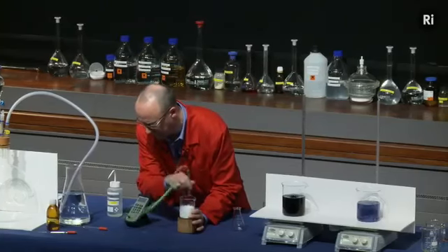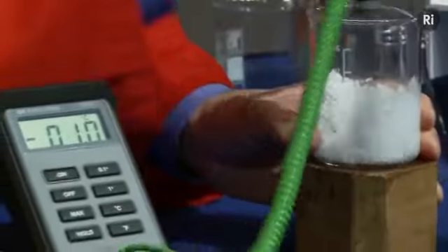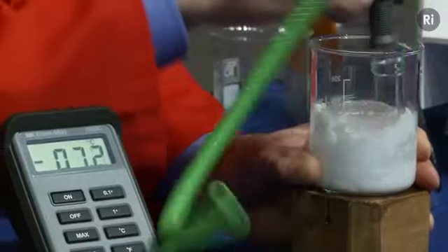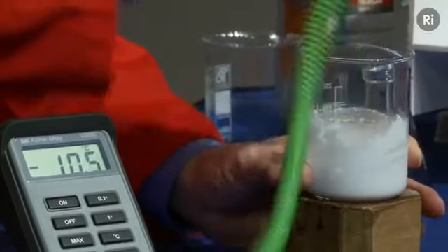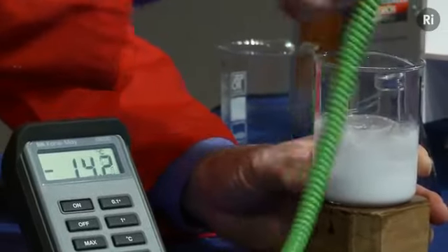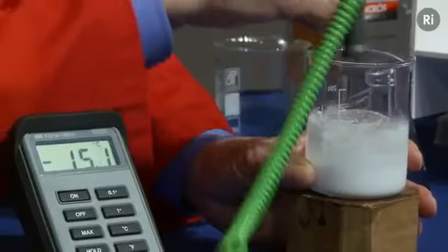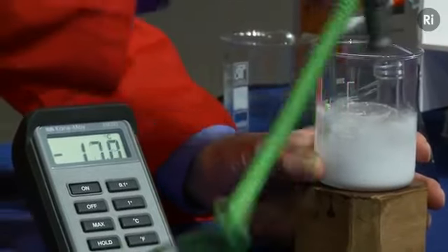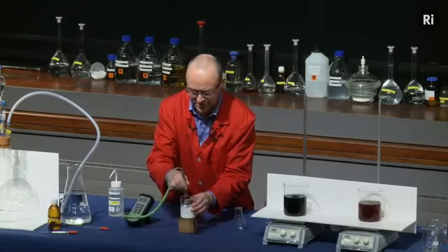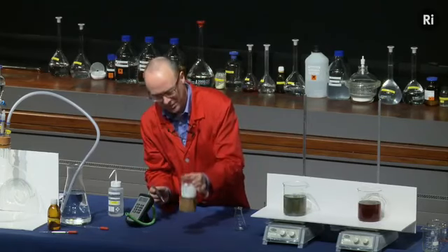So the temperature is falling very quickly, well below 10 degrees now. And the temperature has just gone negative. This is now below 0 degrees, so it's minus 7 degrees. So the temperature is falling very rapidly. The other thing that's happened is that it's turned from a solid into a liquid. So it's now become a sort of slushy white liquid. The temperature is down at minus 15 degrees, so well below the freezing point of water. Now remember, I stood it in a little puddle of water, so what should have happened is that water should have frozen, and there we are, it's frozen it to the block of wood.